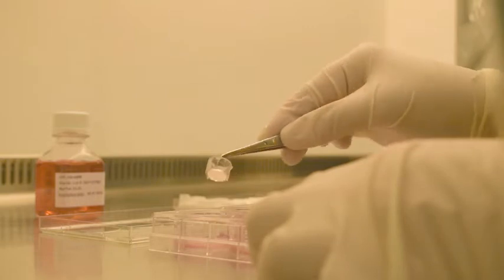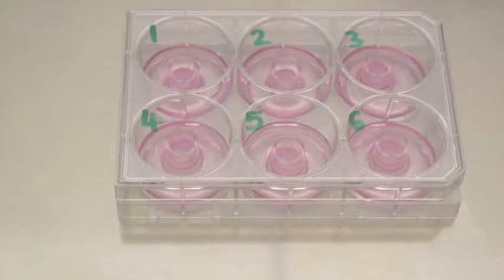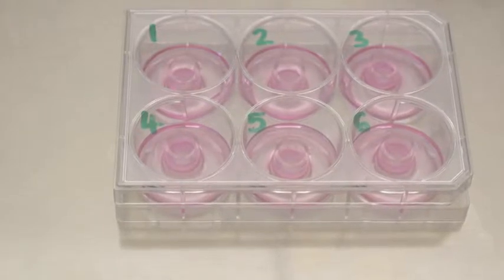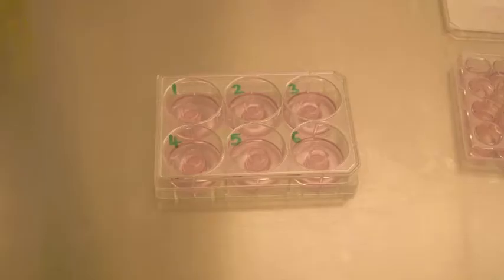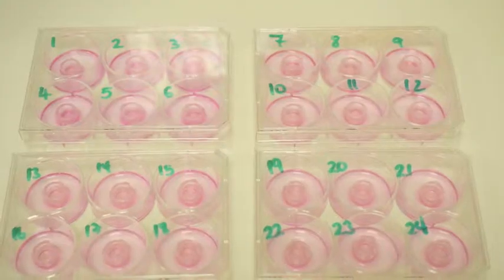The tissue within the tissue cup is then placed at an angle into the medium. This prevents the formation of air bubbles underneath the model, which prevents incomplete feeding of the live basal cells.